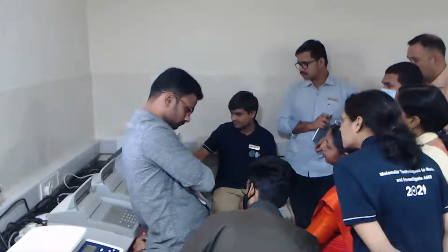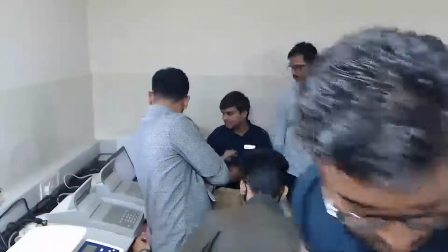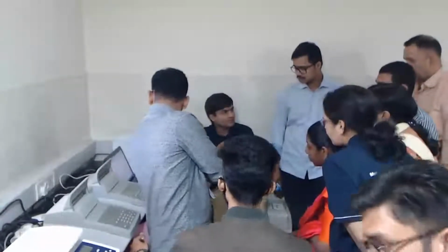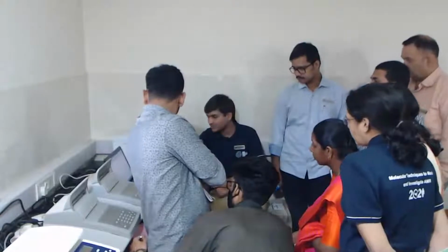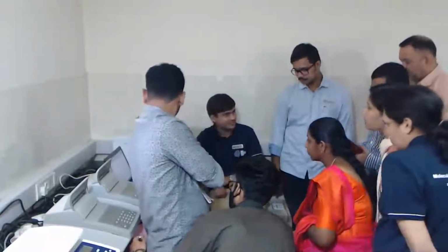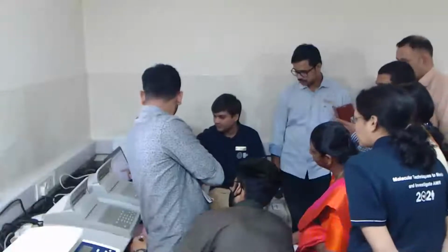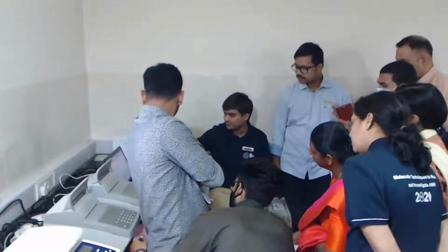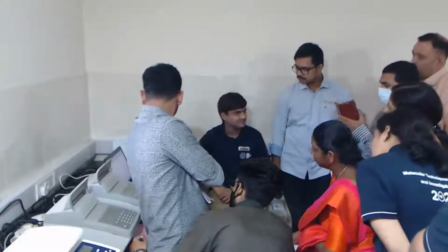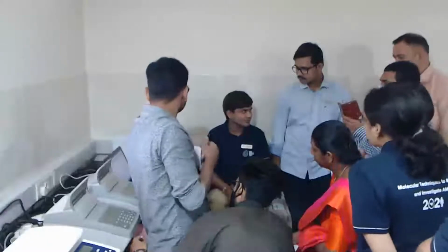First, we have sample of ladder. So over here in DNA 1000, the lower marker is of length 15 bases, upper marker is of length 1500 bases, and you have your ladder peaks in between: 25, 50, 100, 150, 200, 300, 400, 500, 700, 850, and 1000. So this is the expected pattern of ladder.